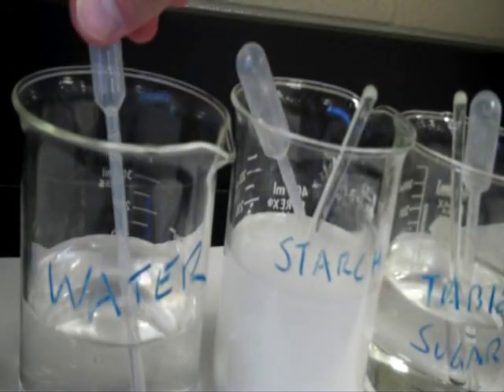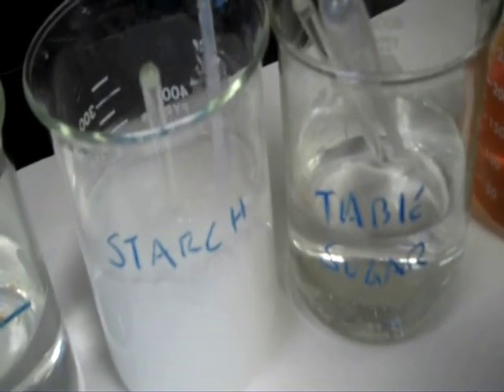For the first test, we're going to use iodine. Iodine turns starchy foods a blue-black color. We're going to fill the wells in our tray with a little bit of each of the substances we're testing. Notice how we put water in number one because it's our control — we don't expect anything to happen to it. Starch in number two.